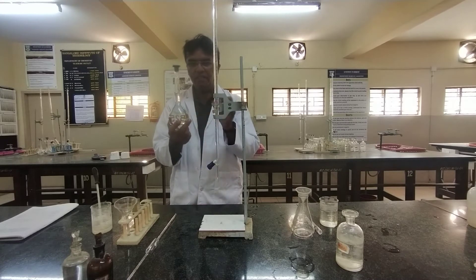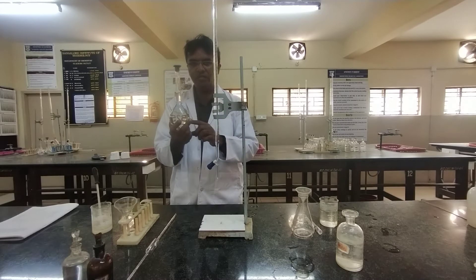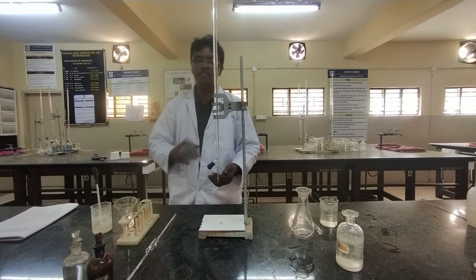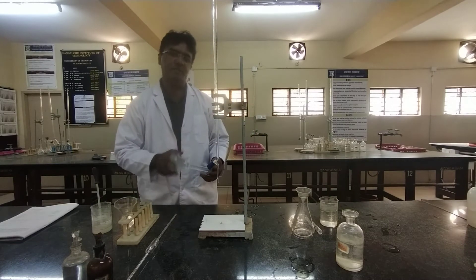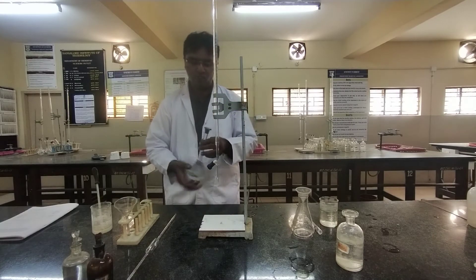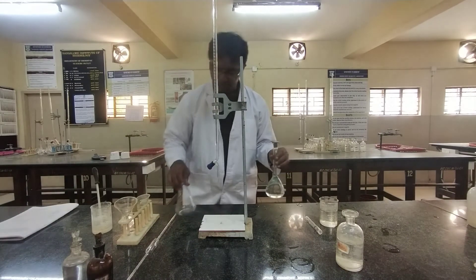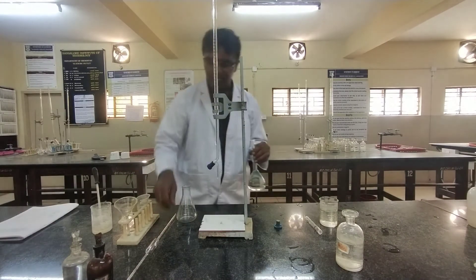You take the fixed amount of brass solution into the volumetric flask, add water up to the mark, close the lid and shake for uniform concentration. This completes part one of the experiment. Once that is done, you pipette out 25 ml of the brass solution into a clean conical flask.